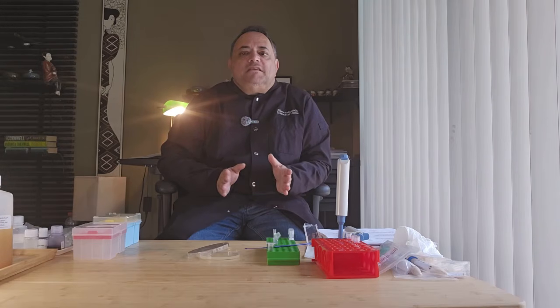So the first part of the experiment is to grow our E. coli bacteria on LB media. So let's do that now.